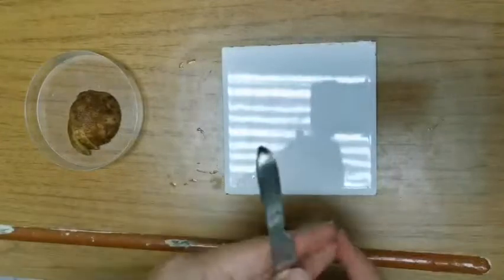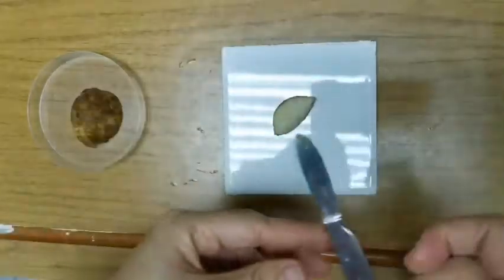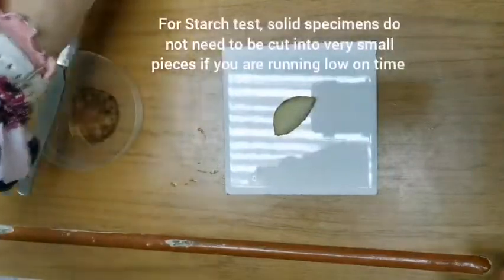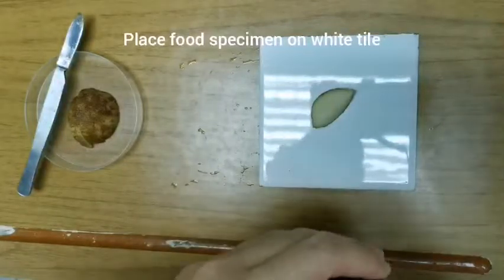Now the first one, if we are testing with iodine solution, is actually quite easy. You don't have to chop it up. It's the only one where you don't have to chop it up into small pieces, even though it is a solid food specimen. What you do is you place it on your white tile, because it's a very clear background, so you can see the color change very easily.